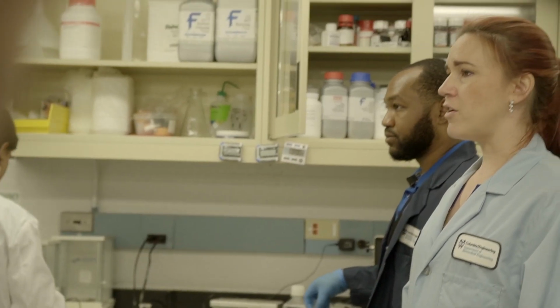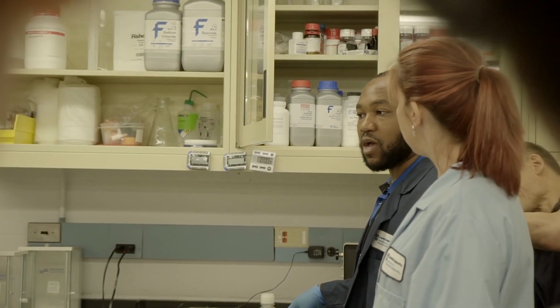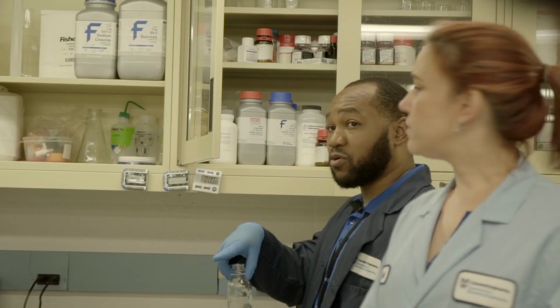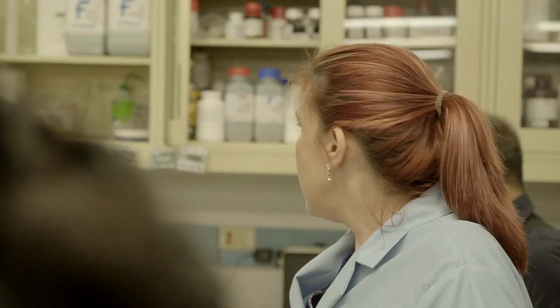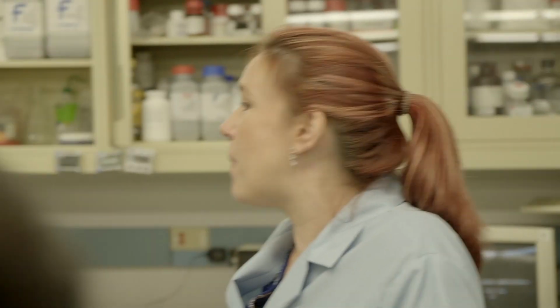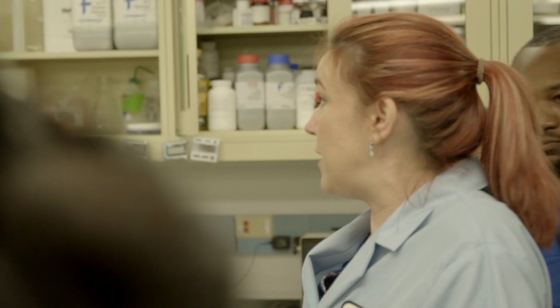A 2% agarose gel. And how much volume do we need to make our cast? We need 50 milliliters for the gel. 50 milliliters. So it's actually in your protocol. I don't know if you all did that calculation yet. So if you haven't, let's review. So how much agarose, weight by volume, always, it's grams by mils. So the grams need to be 2% of 50 mils. So how much agarose are they measuring out to make a 2% gel?